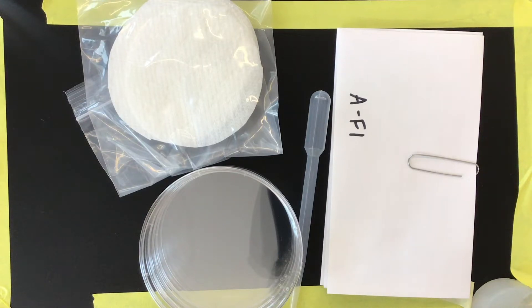Hello. We are going to set up a genetics experiment. We are going to be planting some seeds from an F1 and an F2 generation for two different characteristics or sets of characteristics. So I'm going to show you in this video how to set up your plates.